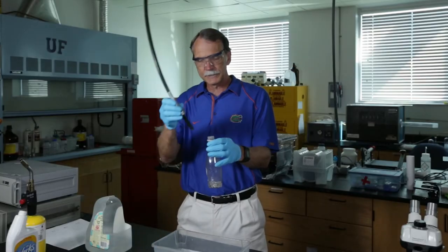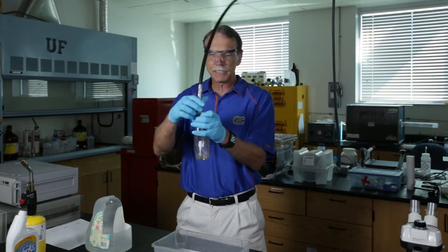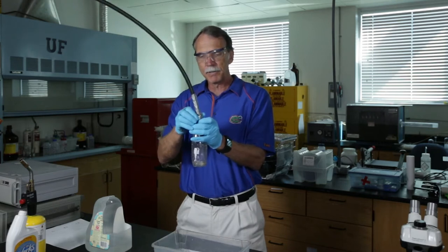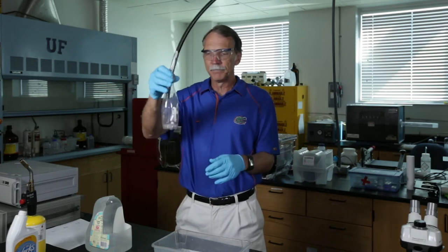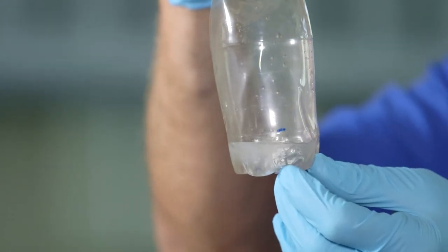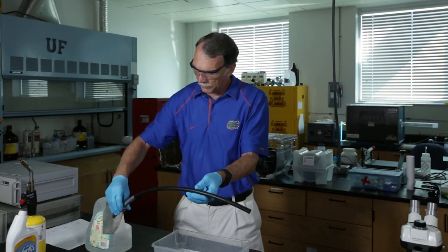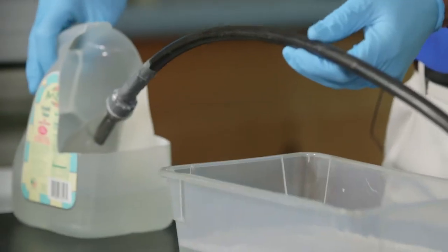The hydrochloric acid is going to react with the aluminum, and the aluminum oxide layer is going to break down. It takes a few minutes for that aluminum oxide to break down, and once it does, it's no longer going to prevent the reaction, and the aluminum is going to start to form aluminum chloride. If you watch it a little bit, you'll start to see it bubble. I'm going to put this in here just as a way of keeping it from getting too hot.